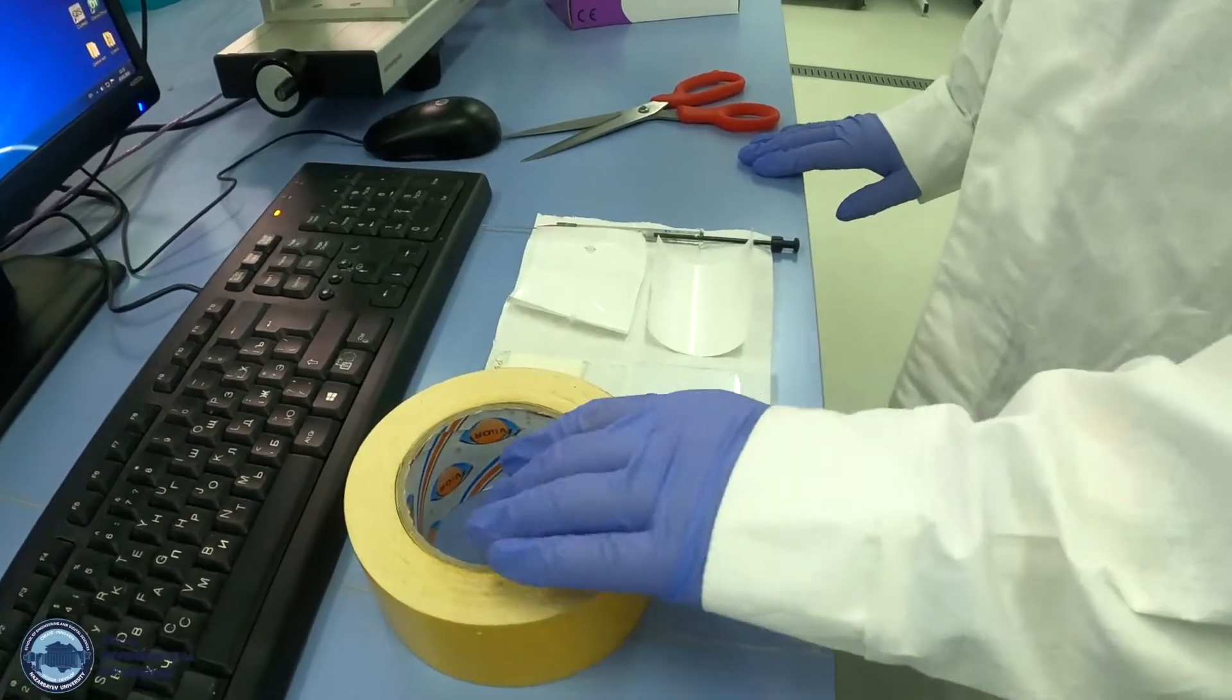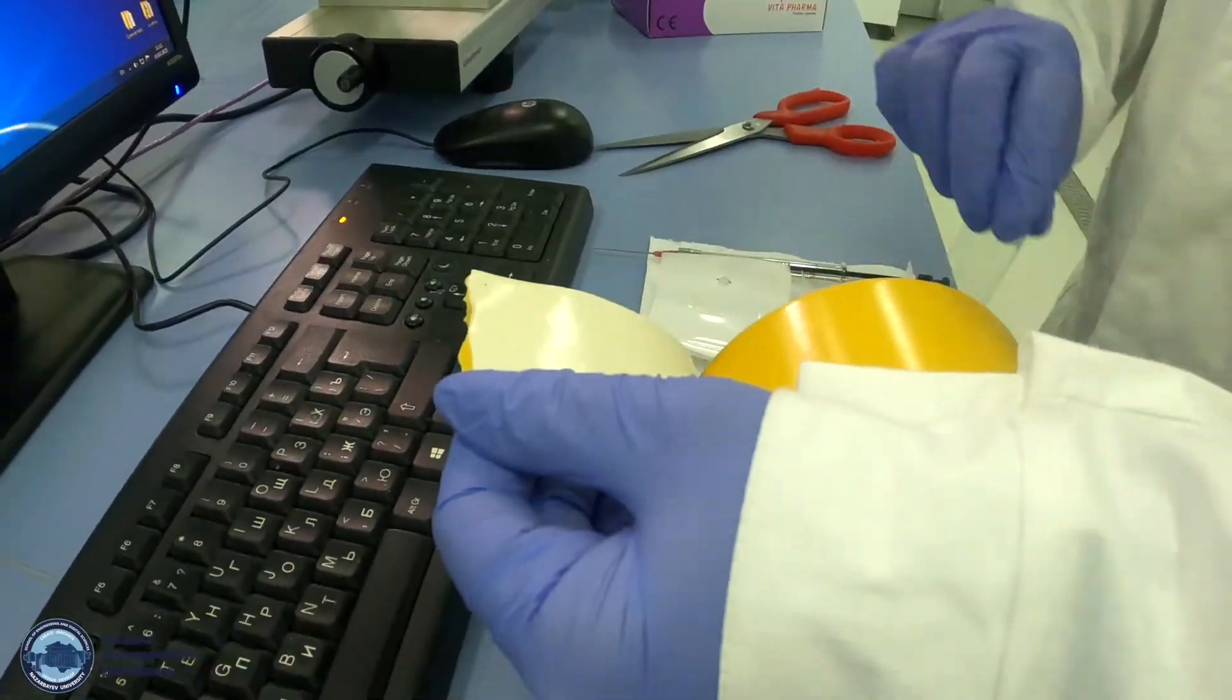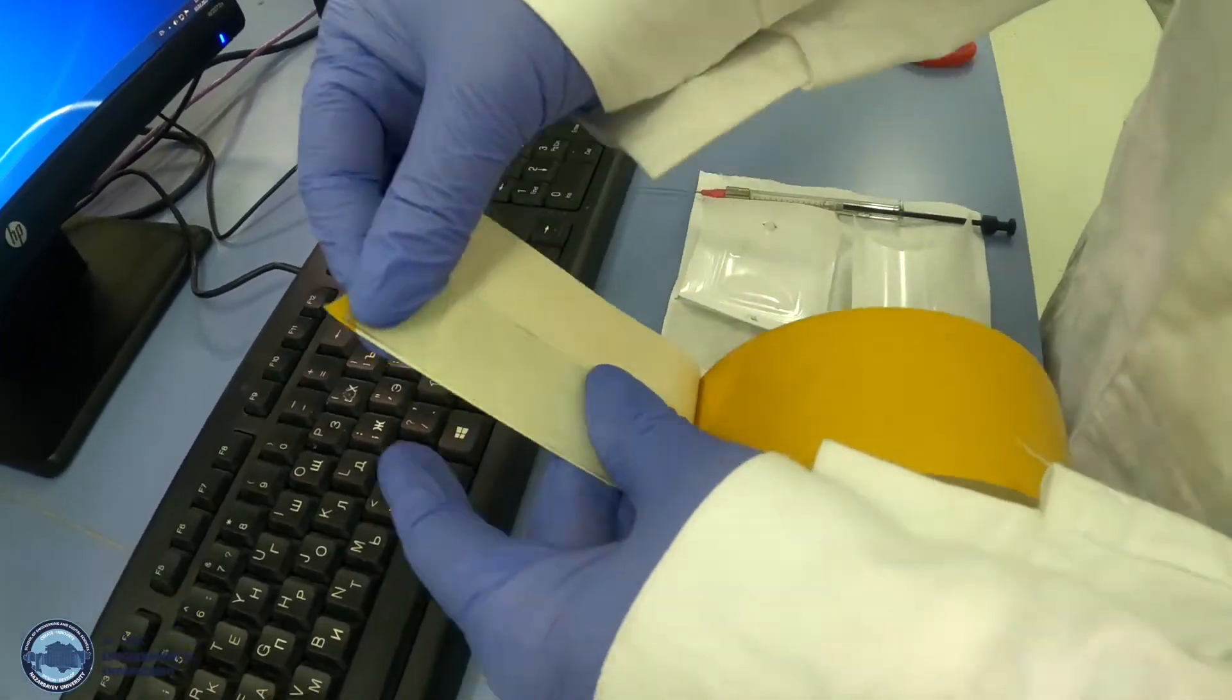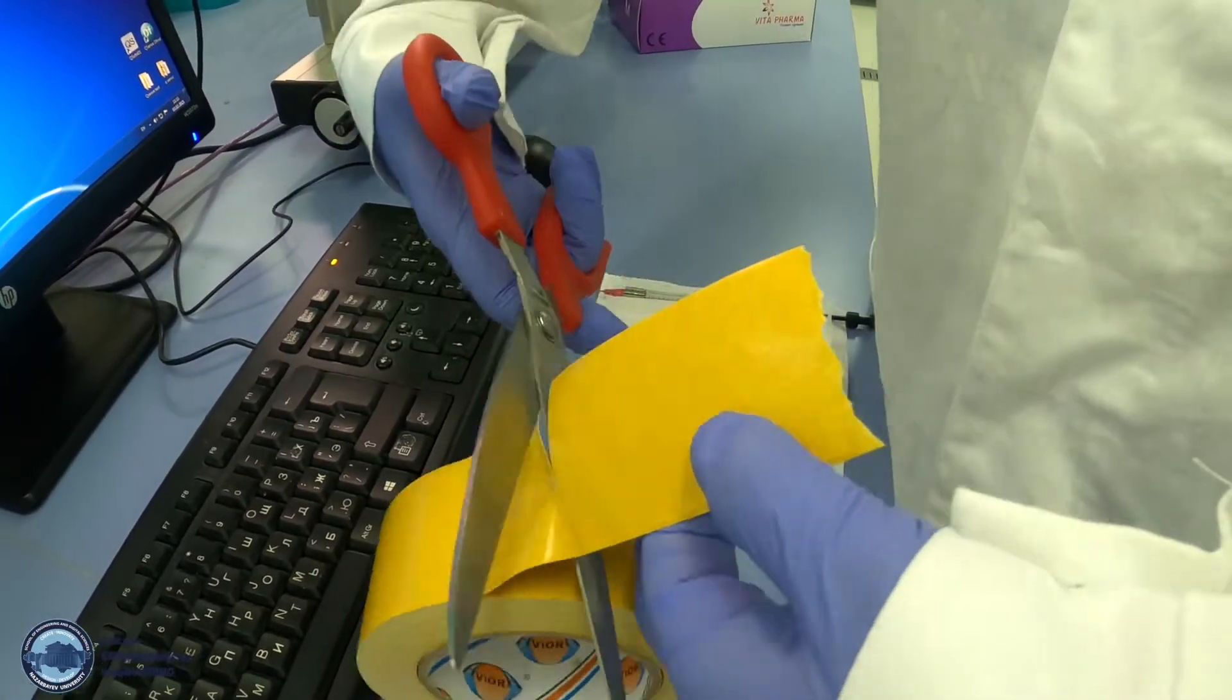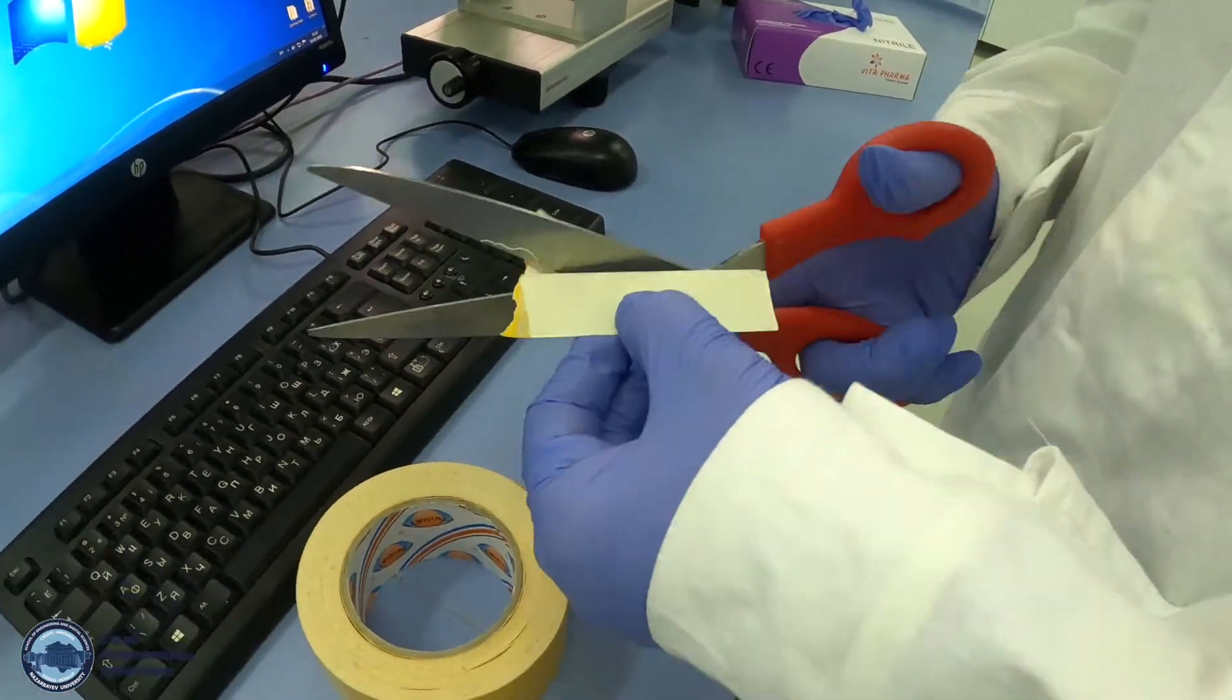Let's start the test. We'll attach double-sided tape on glass plate and cut it so the tape will cover glass plate fully.